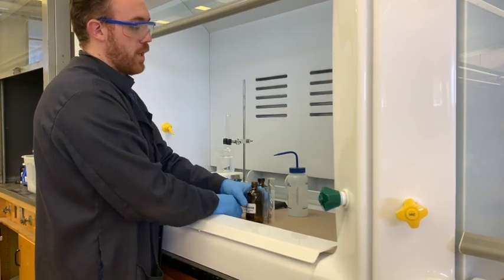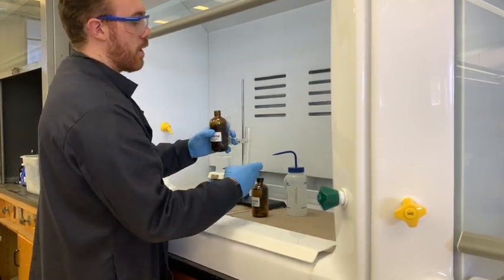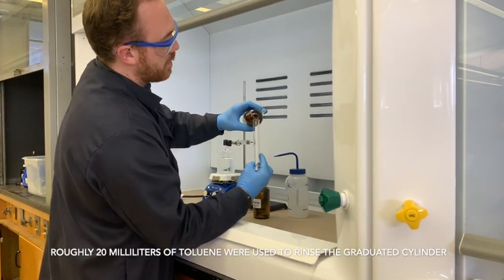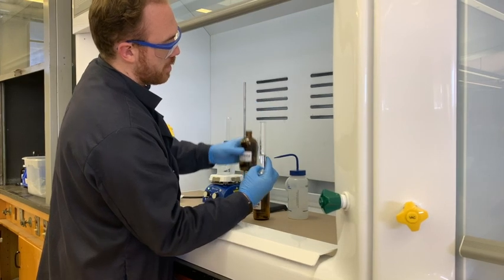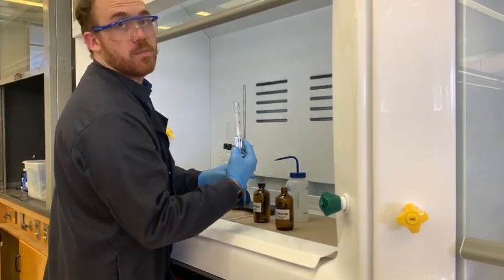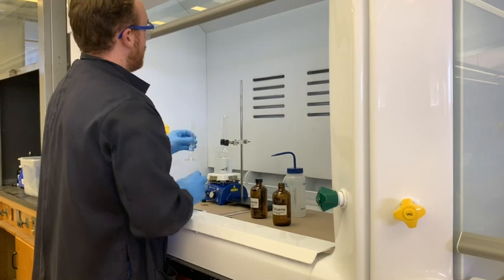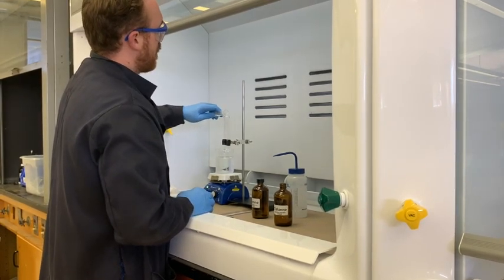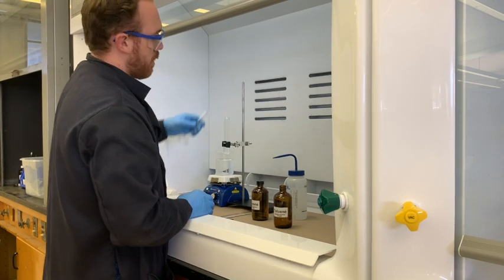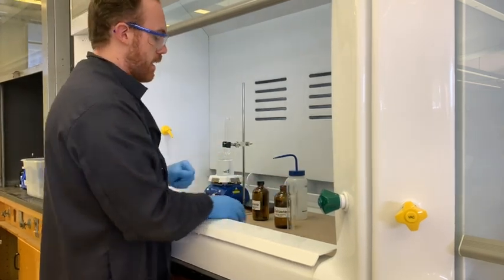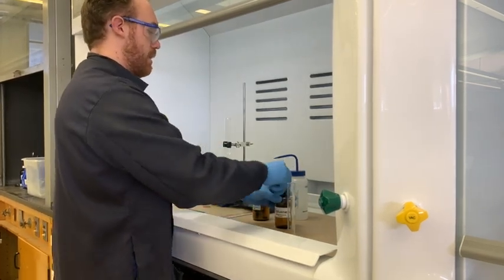I'm going to take the toluene, and we're going to just use it to rinse the last tube. If you get a little bit more than 10 milliliters, it doesn't matter too much. So now they're allowed to mix, let's set these aside.